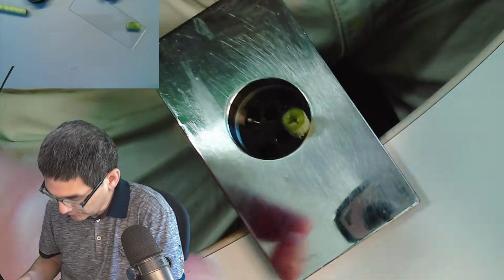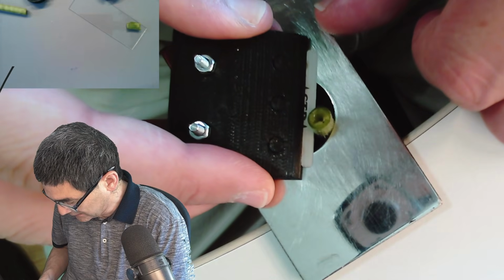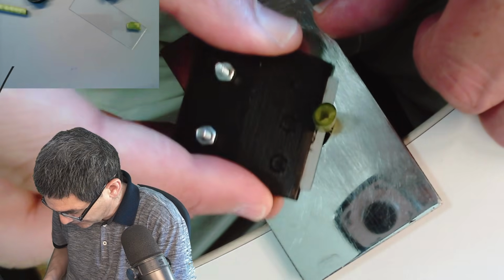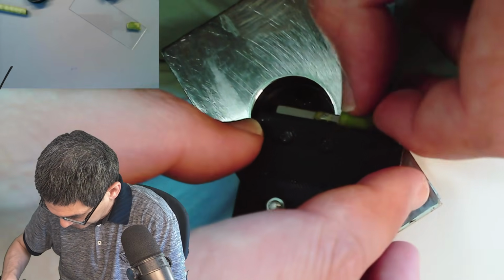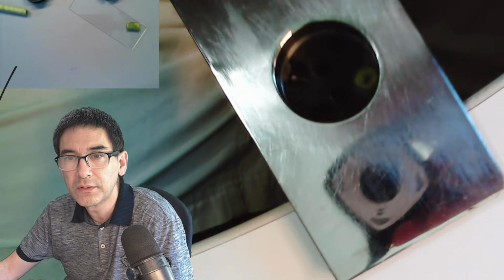And now this is going to be a little bit of a challenge. I'm going to try to cut it like this. First of all, I have to cut the top off here. Let's give this a try. You see it's still fairly difficult to cut off, because it's pretty thick. Okay, see. Usually the first one is always a little bit more difficult. I don't know if you're able to see it bigger.